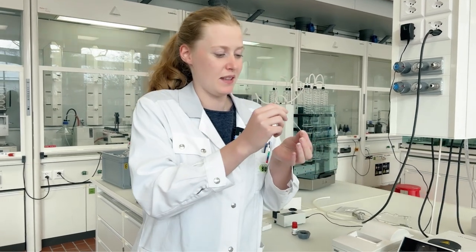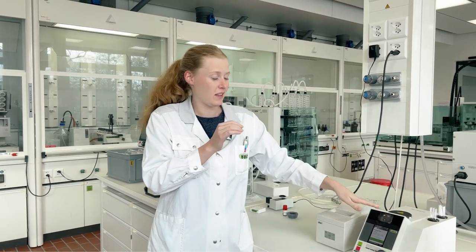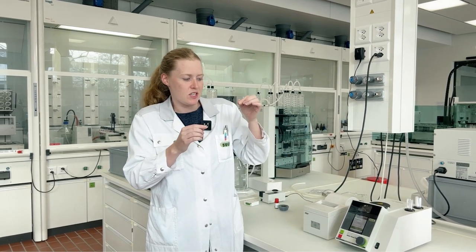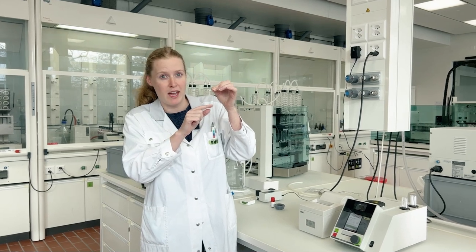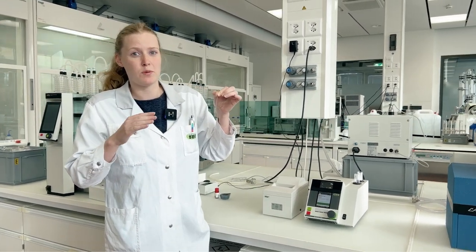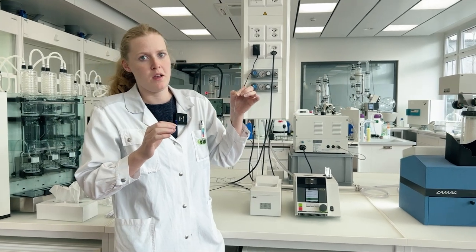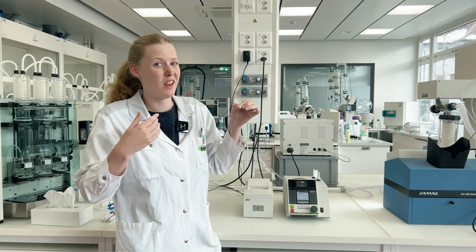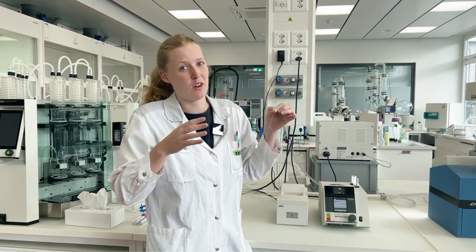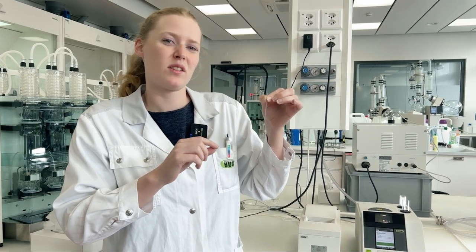Measuring the temperature is a little tricky because our sample is in a small capillary and we can't get a thermometer in there, so the temperature we actually measure is that of the melting point device itself. The temperature isn't exactly the same in the capillary and in the heating block, so the trick to get a precise result is to use a very small gradient, keeping the difference small. But a smaller gradient takes more time, so we need a compromise: small enough for precision, but not so small that it takes too long.